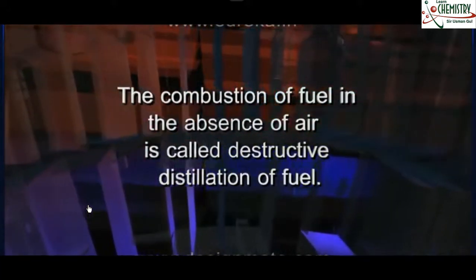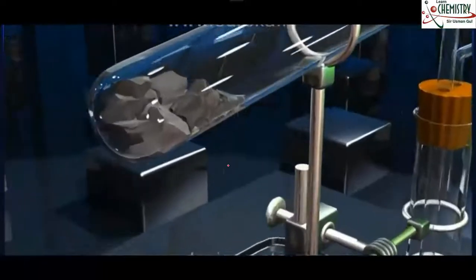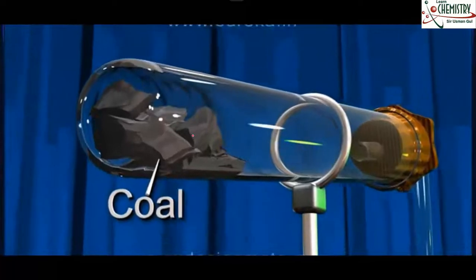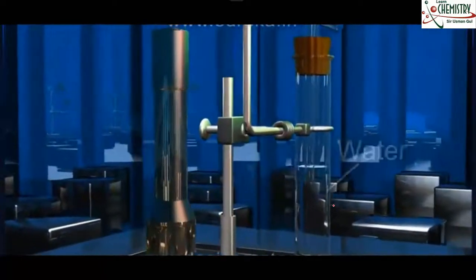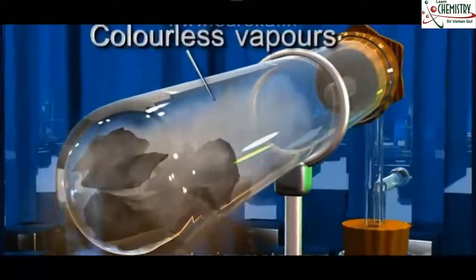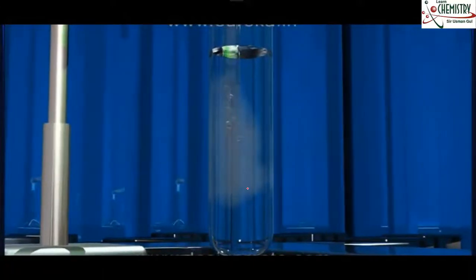So we can use any type of fuel, and our objective is to understand the destructive distillation of the coal, so we will do the same thing. First we need a glass tube having coal, and this glass tube should be connected with another glass tube having water. Okay, what happens when we heat this coal in the absence of air? So colorless vapors pass through the delivery tube into the next tube containing water.